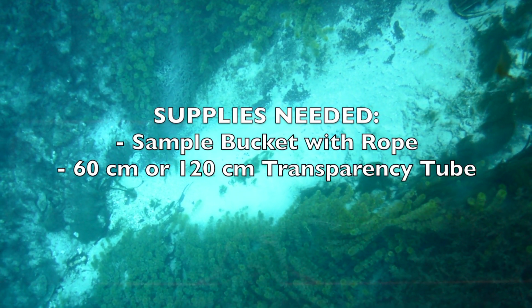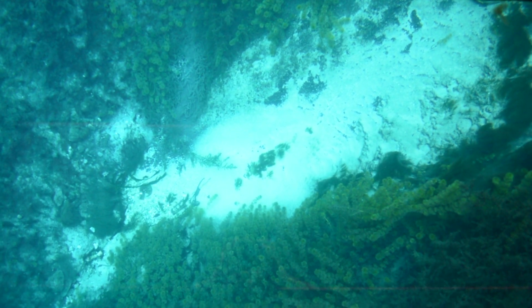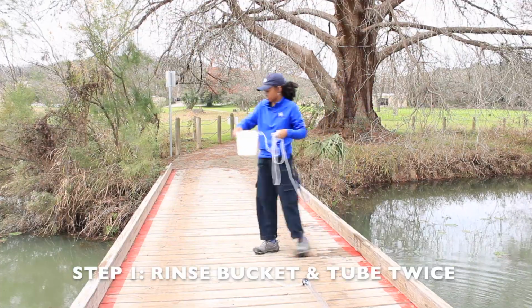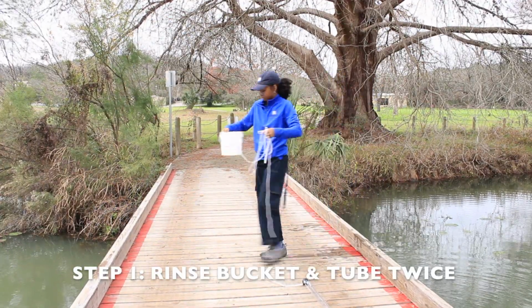Supplies needed include a bucket with a rope and either a 60 centimeter or 120 centimeter transparency tube. For step 1, rinse your bucket and transparency tube twice, making sure to dispose of the water downstream.